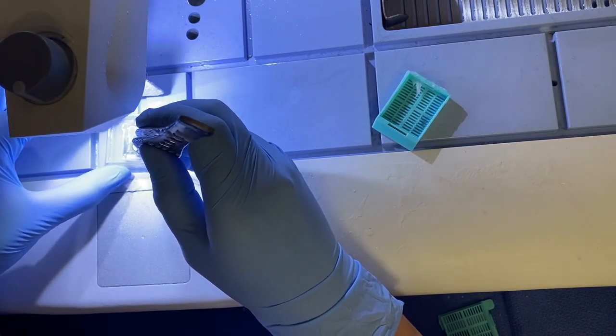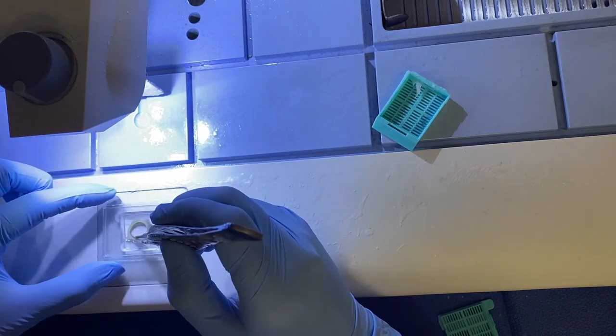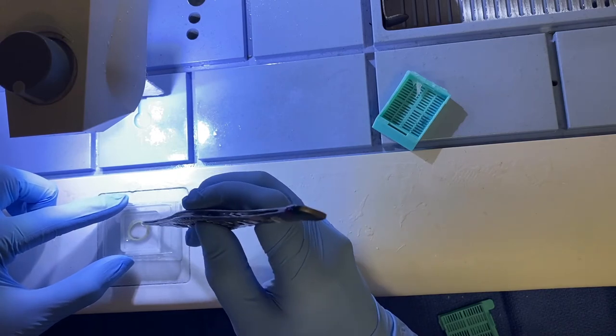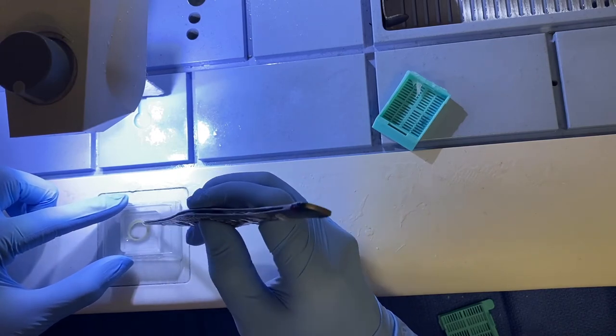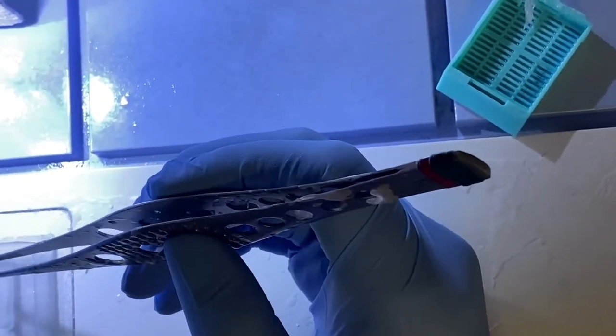You can hold it down so it's flush at the bottom, move it to the cold plate so that it solidifies in the exact position you want it to be. I always kind of push along all the edges to make sure that the bottom is flush, so when we go to section our tissue, it is easiest to cut and face evenly.